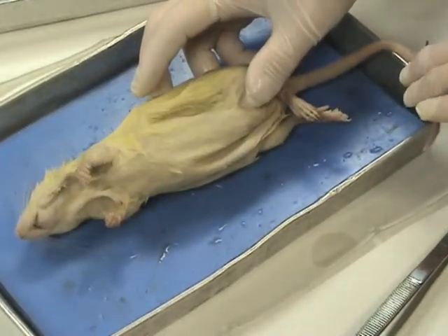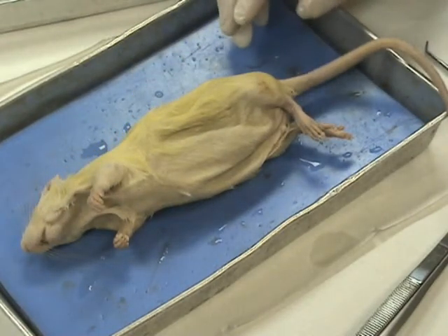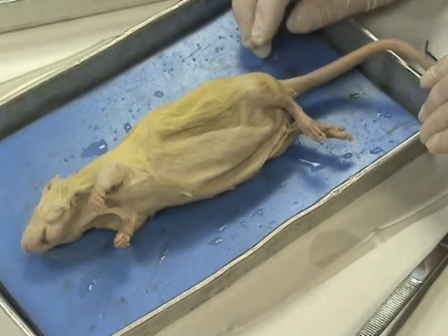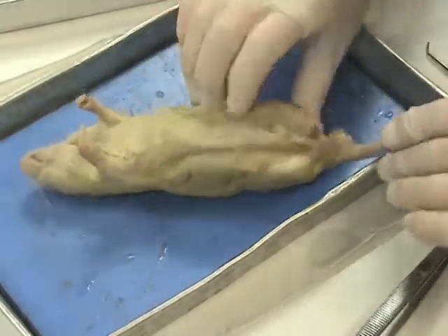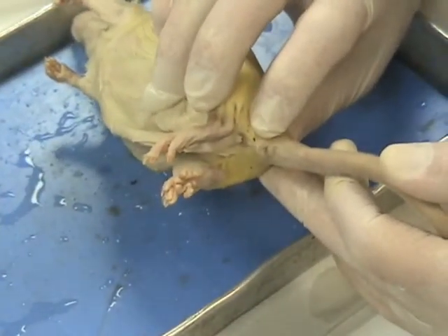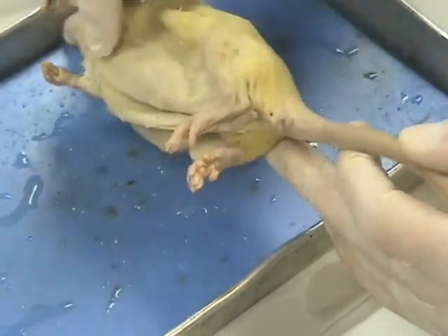Next, we need to figure out what the sex of your rat is. And the directions that you have on that sheet there tells you that the males have the testes, which are located cranial or anterior to the anus. Now, when we're looking for the anus, we're looking up right underneath the tail. In this case right here, we have the anus, and if we're going towards the anterior or cranial end, we're going to be moving towards the head, towards this direction.